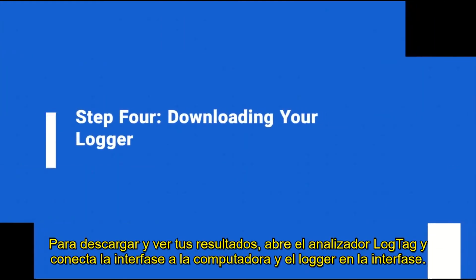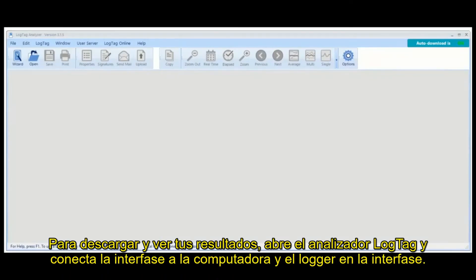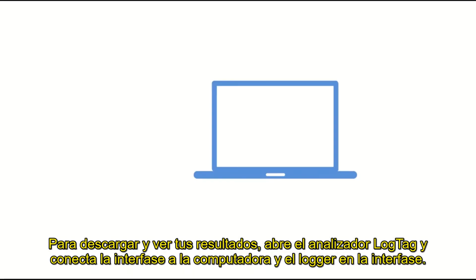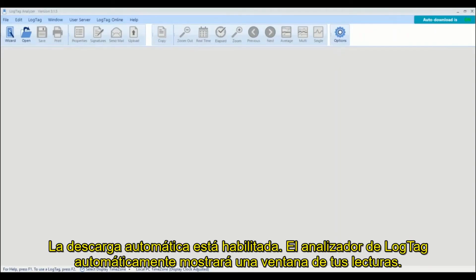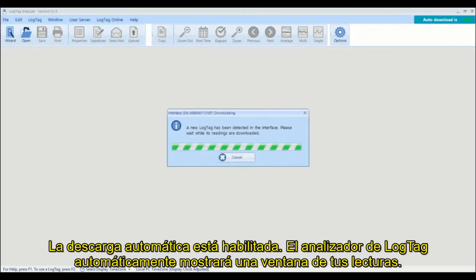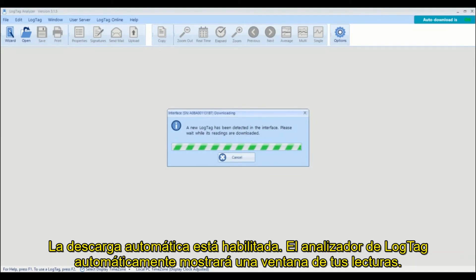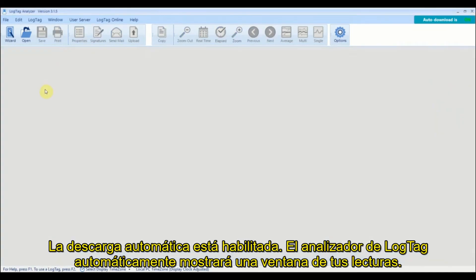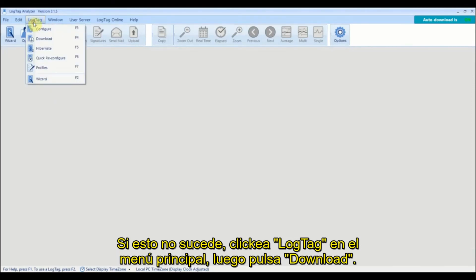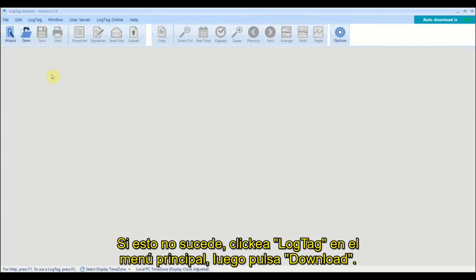To download and view your results, open LogTag Analyzer. Then connect your interface cradle to the computer and insert your logger. If auto-download is enabled, LogTag Analyzer will automatically display a chart of your readings. If not, click LogTag from the main menu, then click Download.